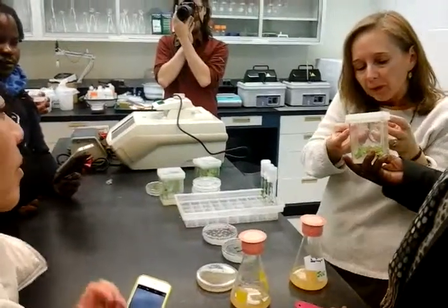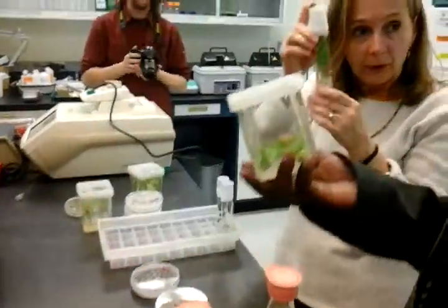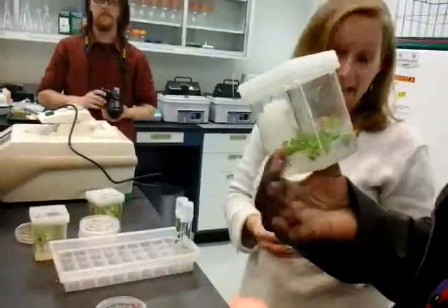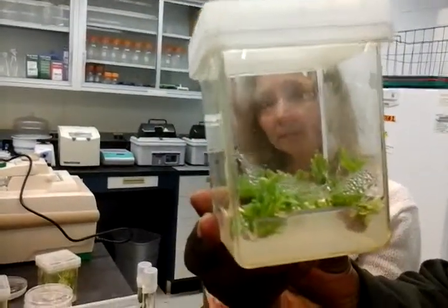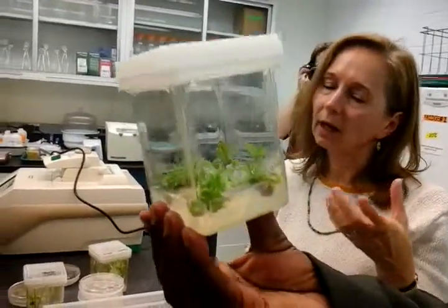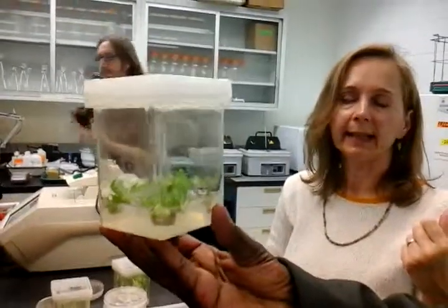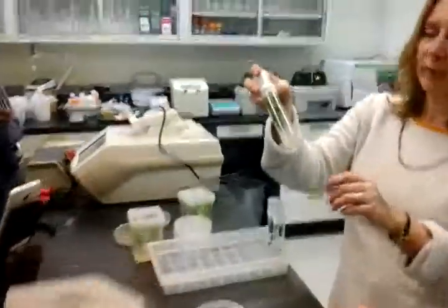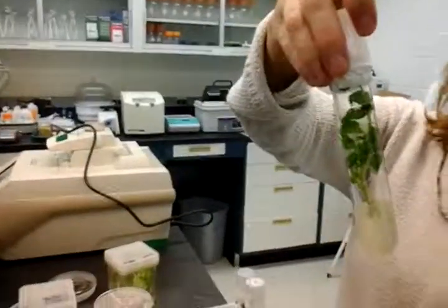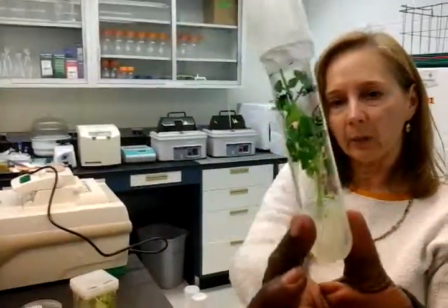So right now we're just waiting for the plants to grow up some more so that we can take cuttings. The one below — that's an agar nutrient medium, Murashige and Skoog. Zeatin is the plant growth regulator, a cytokinin, and there's zeatin in that medium. The gelling agent is called agargel. When the plants get bigger, we put them into a test tube to root — you can see the really nice roots. We're using magenta boxes for rooting and we get really nice growth.